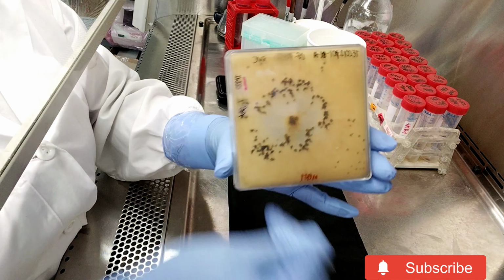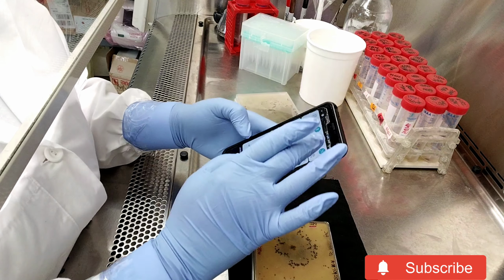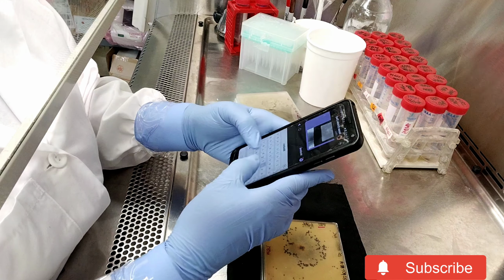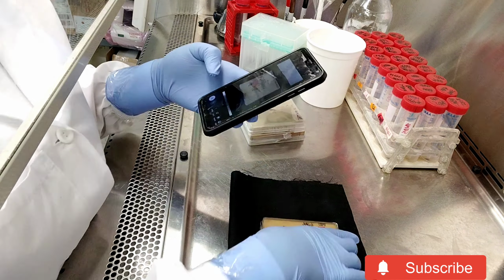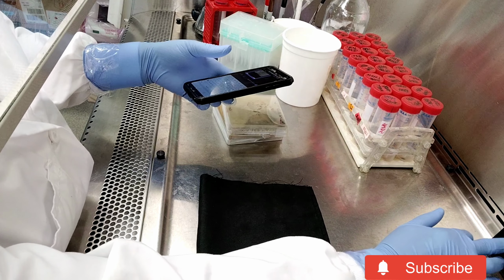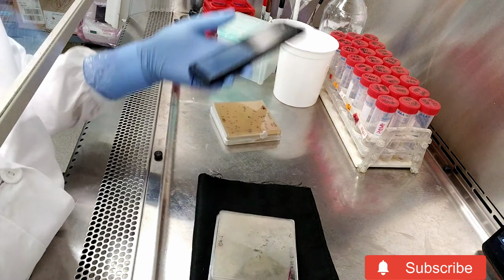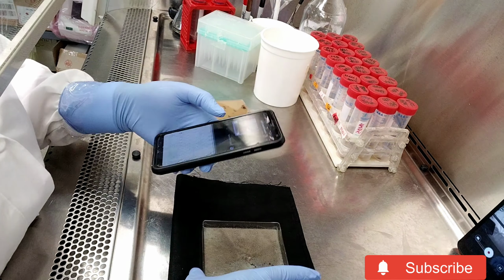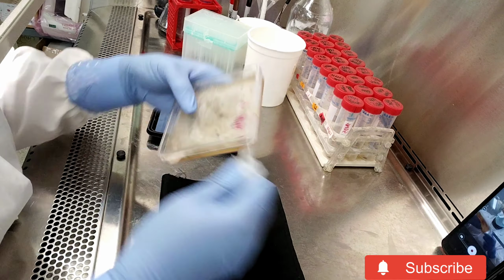Inside the BSC, I have the plates that I sterilized before putting them in, and I'm always collecting observation data. It's important, so I do that using photos. I'm setting up my Teams chat that I load my pictures in. I take a photo of the base of the plate, then I open it and take a photo of the actual colony, and I hold them up, ensuring that I'm getting the right angles, and I'll just keep repeating that until I photograph all of the images.